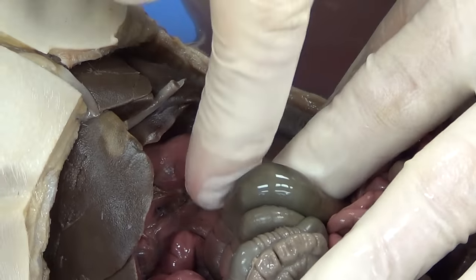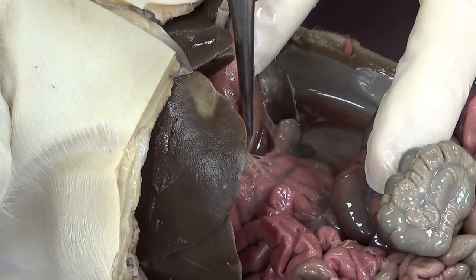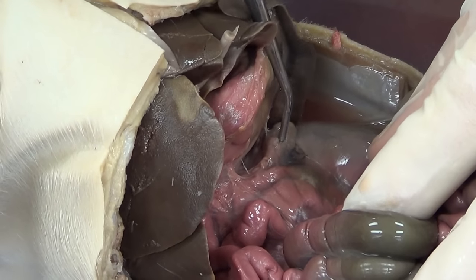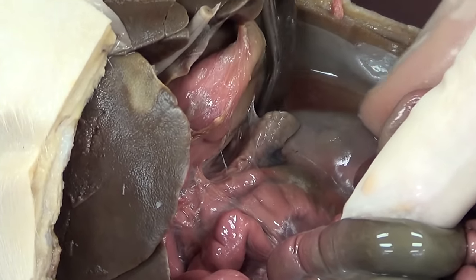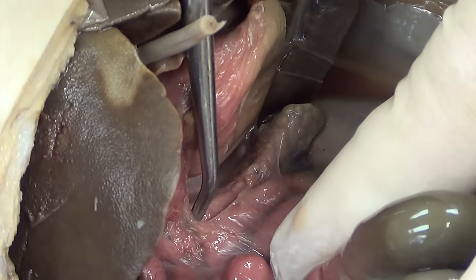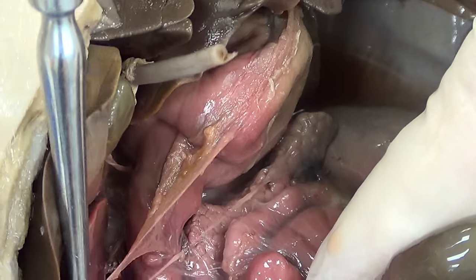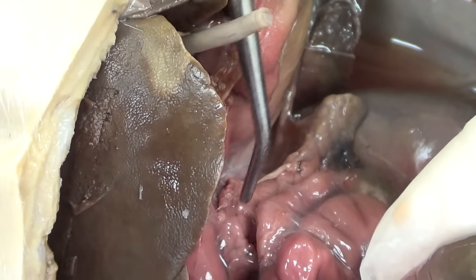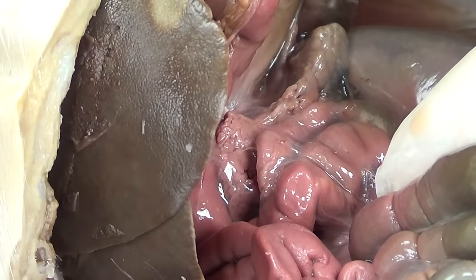As we go to the underside of the stomach, I'm going to lift the stomach up, cut through some tissue, and we see this very grainy structure come into view. You can see it looks like grains of sand, almost like little bits of gravel. Whenever we see grainy-looking structures, we should be thinking endocrine gland — and that's exactly what this is. I want to be careful here because endocrine gland tears rather easily. That endocrine gland is going to be the pancreas.